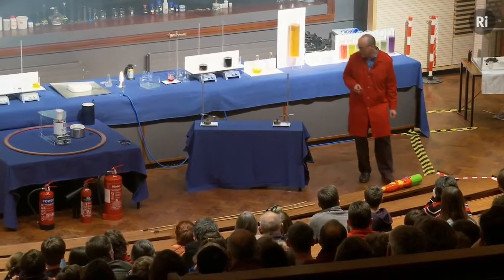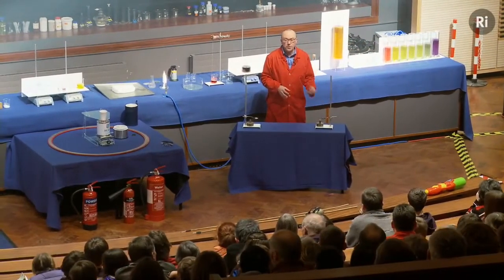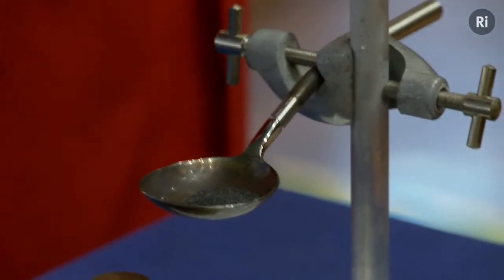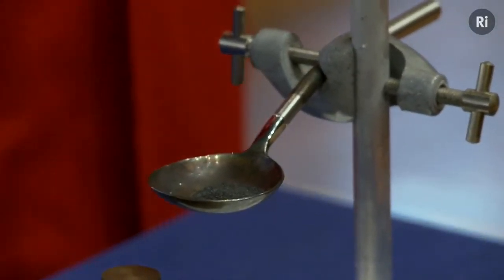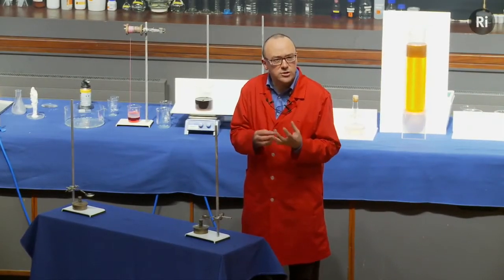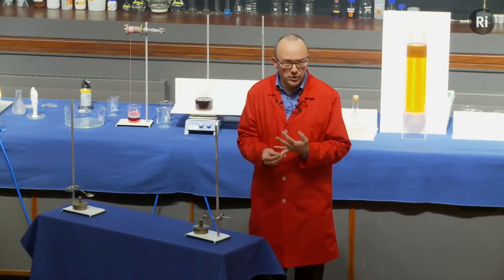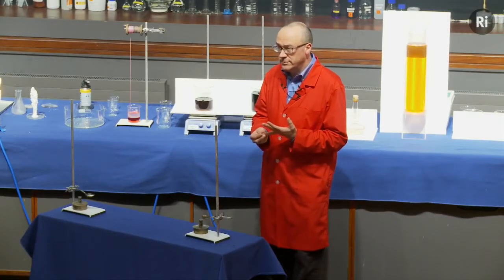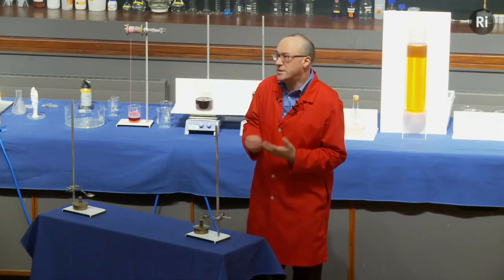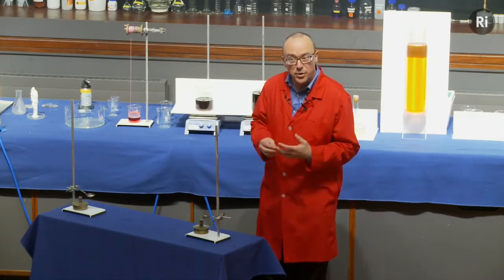Well, perhaps it can. In this spoon, we have a gram of commercial gunpowder. It's made from a mixture of 3 ingredients. Saltpeter, whose chemical name is potassium nitrate, and that acts as a source of concentrated oxygen. We call that an oxidizer. It contains charcoal, which acts as the fuel, and that burns in the oxygen released by the potassium nitrate. And it contains sulfur, and the sulfur is there to aid combustion to make the gunpowder burn more easily.